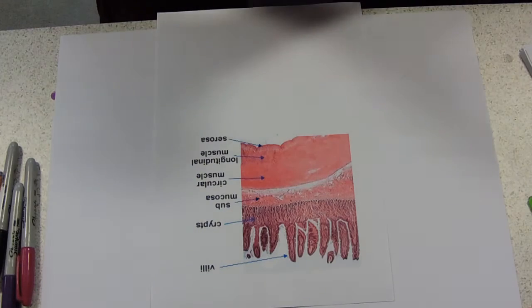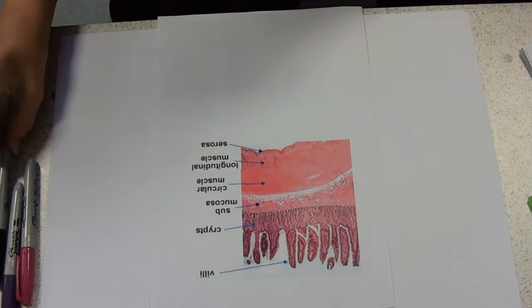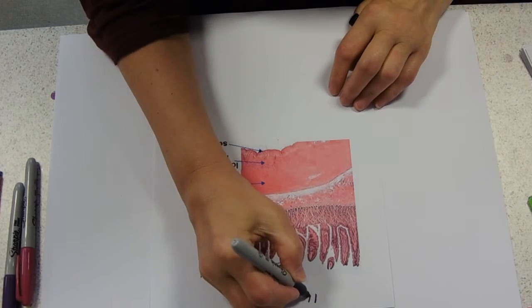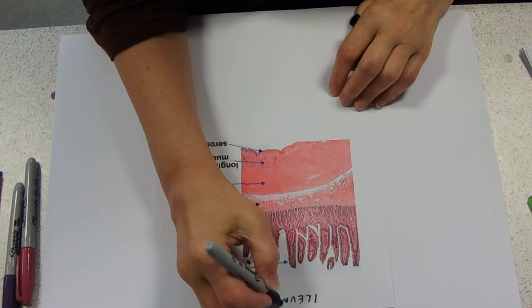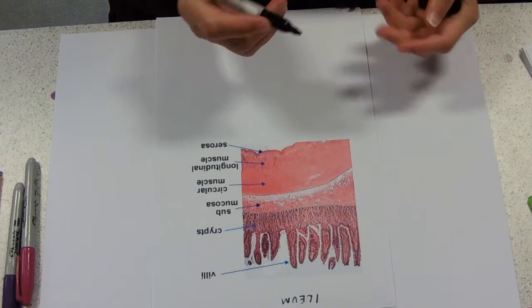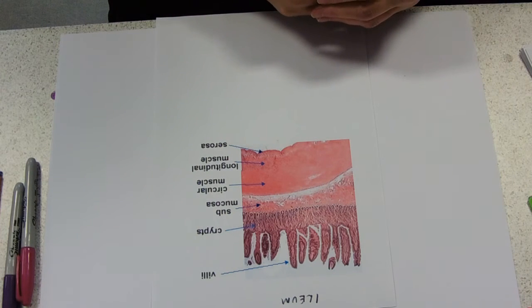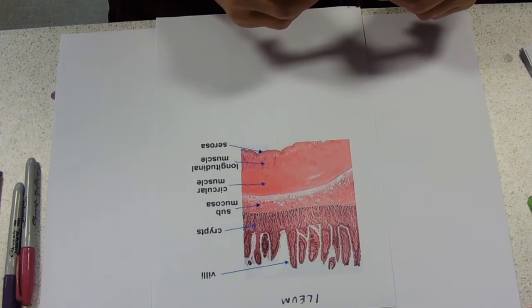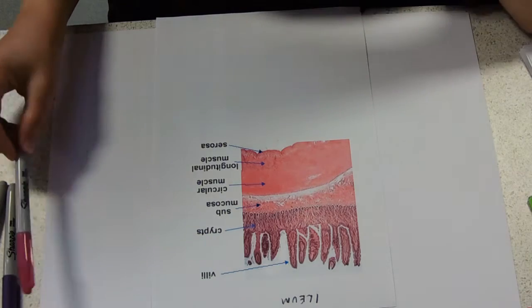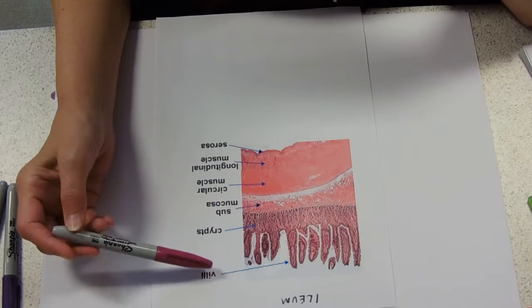Okay, here we go. So we're looking at the small intestine, and we are looking particularly in this video at the ileum. So not quite as cool as the duodenum, but you know, it's getting there. Structurally, if you see it looking down a microscope, which is the view that we've got here, then pretty much you'd be thinking, yeah, that looks pretty much like the duodenum, and it pretty much does. It's got the villi, and we'll go into more detail into the structure of the villus soon.